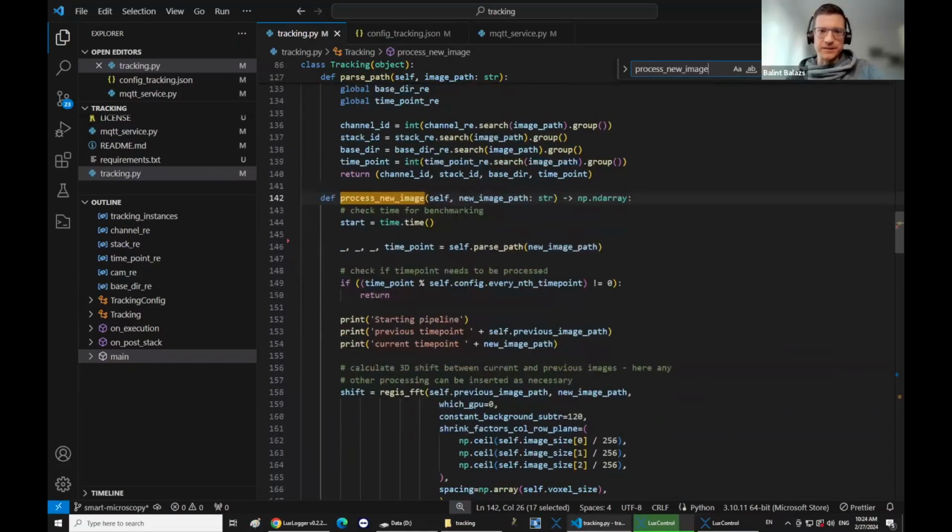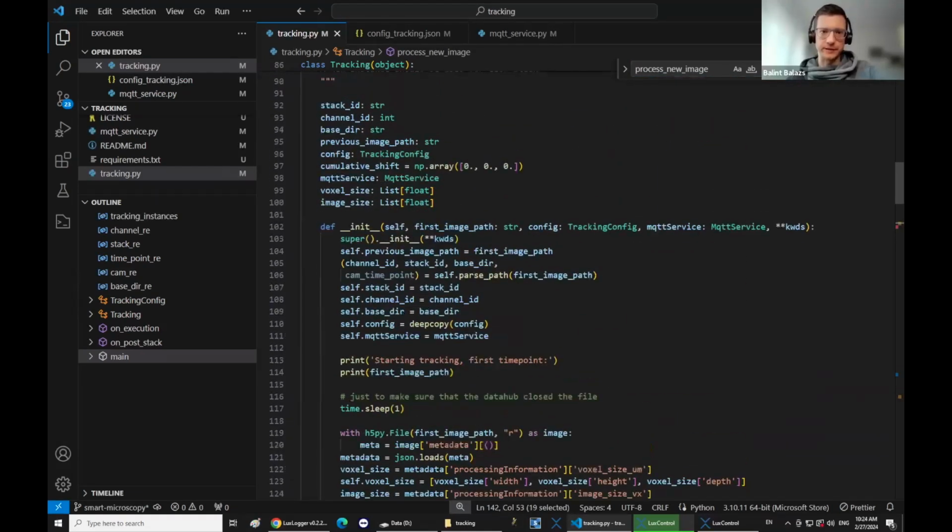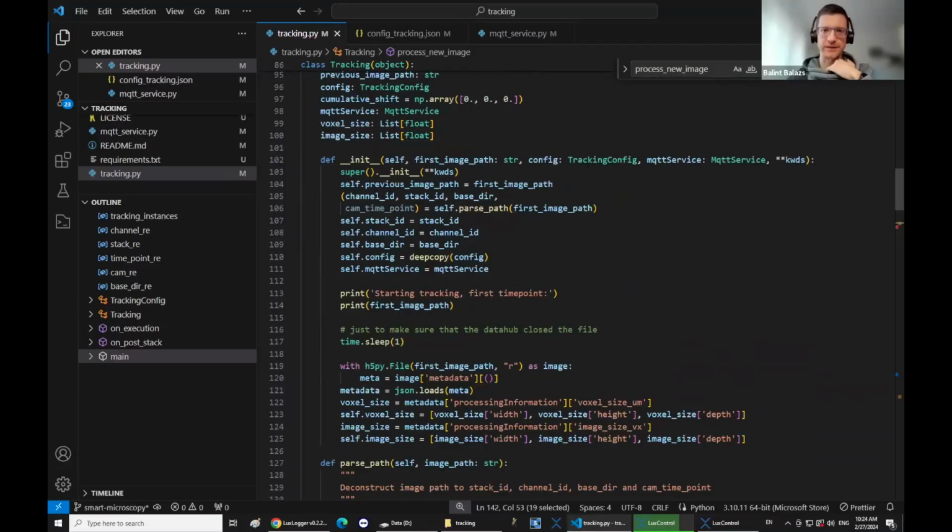So the input here is the new image path. Basically, it's this tracking instance. It stores the previous image path, the channel, the stack ID that you have with some base directory. So it's kind of just to keep track of the state of what's going on, and also a copy of this MQTT service, because it needs to send a new message to the microscope to change the stack.